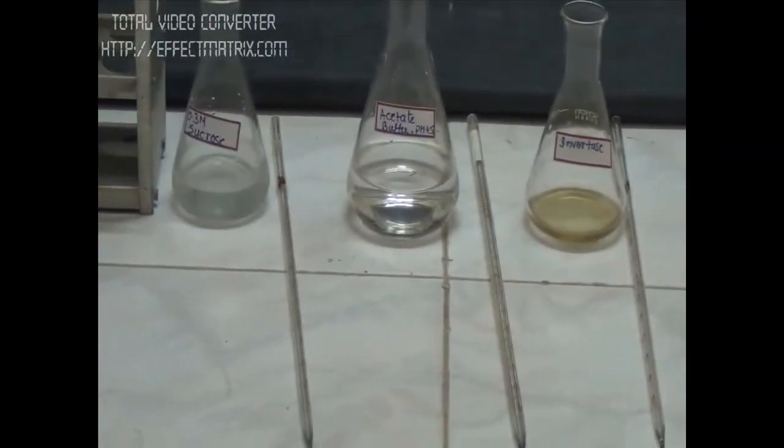Hello, today we are going to do the assay of enzyme activity of invertase.